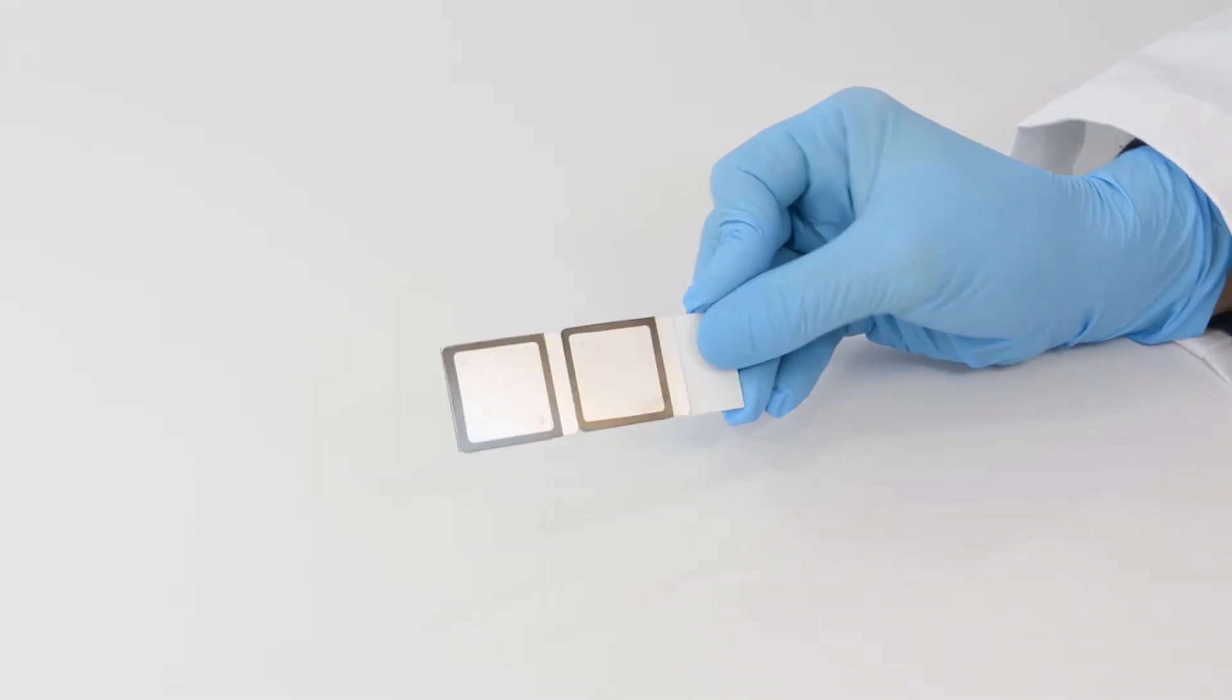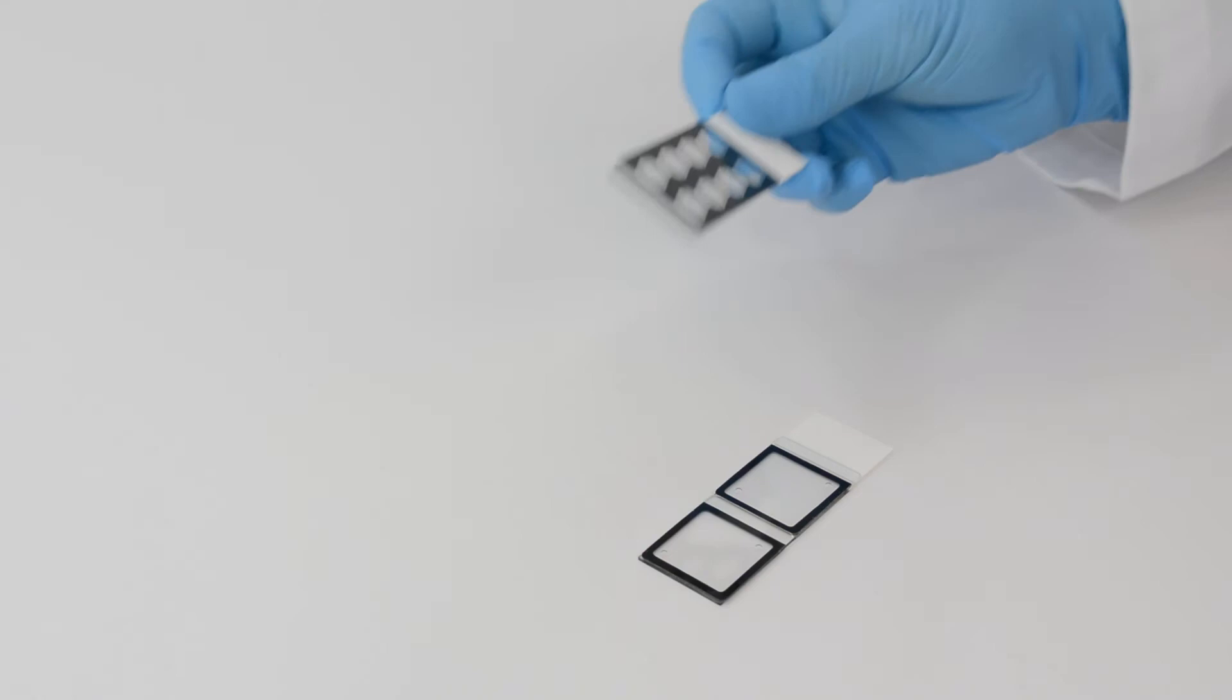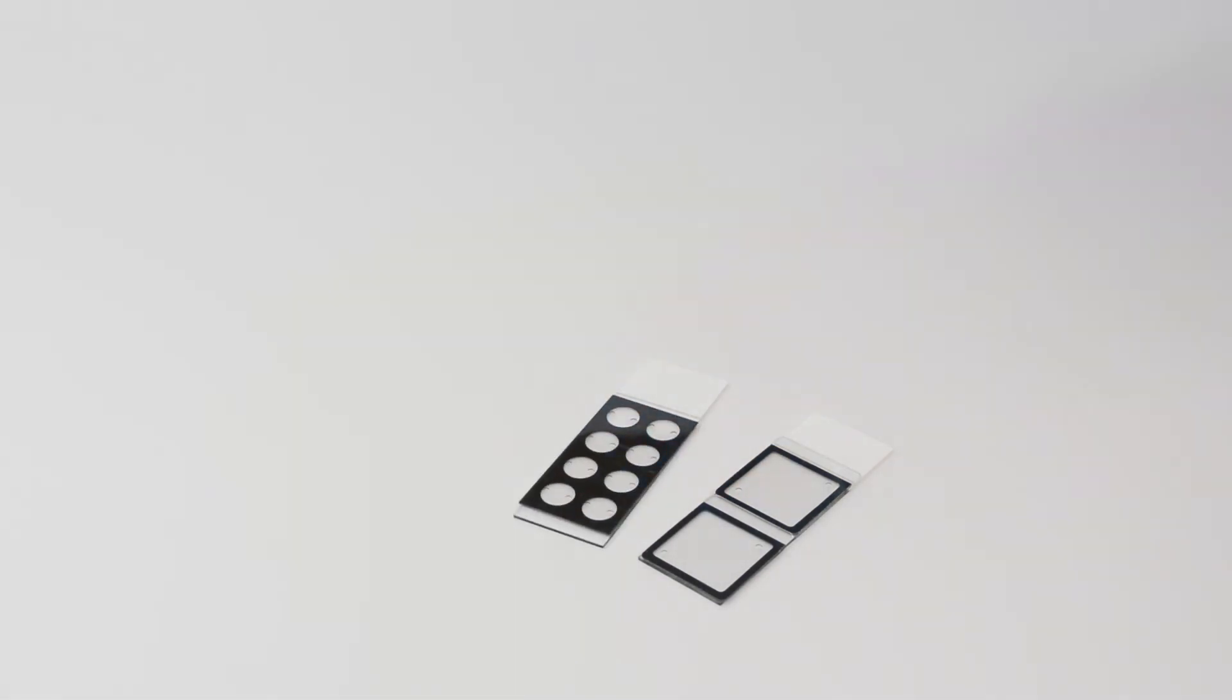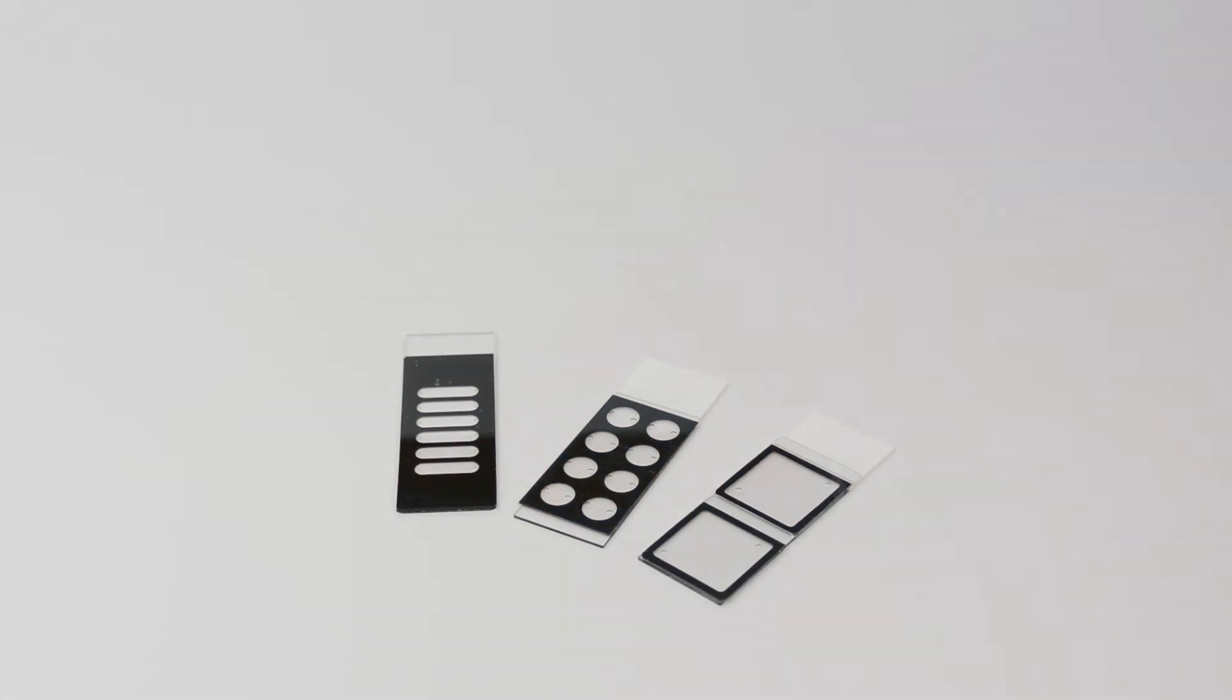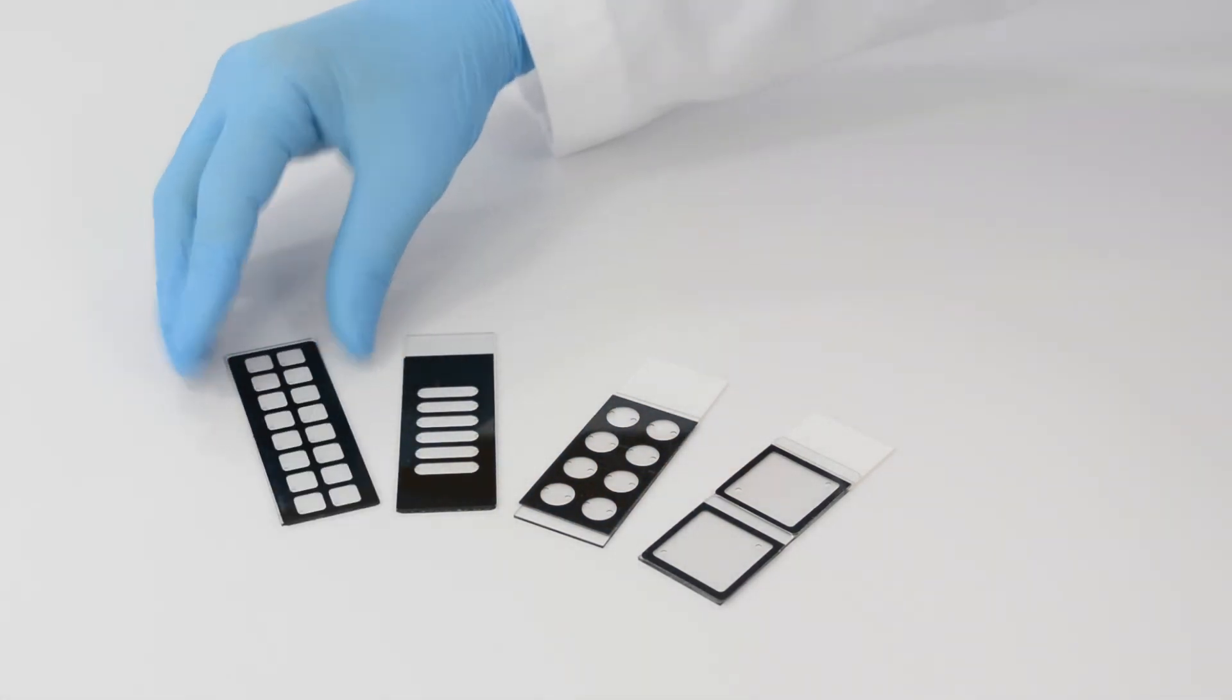For parallel processing, a second chamber may be applied to the same slide, or you can use one of the many available configurations that are shown here and on our website.